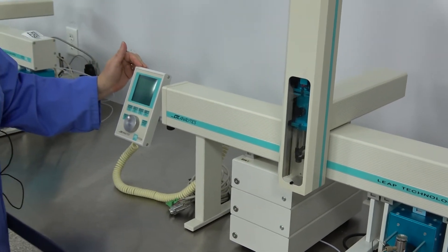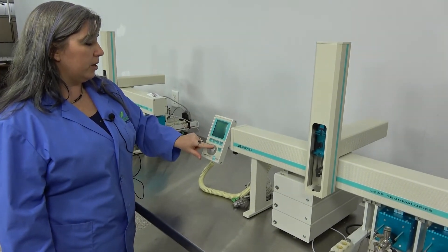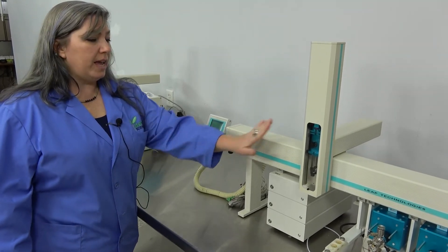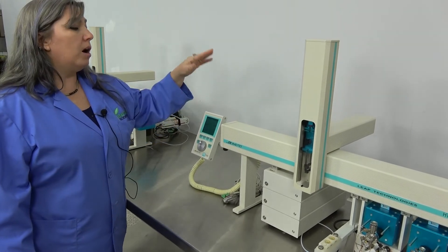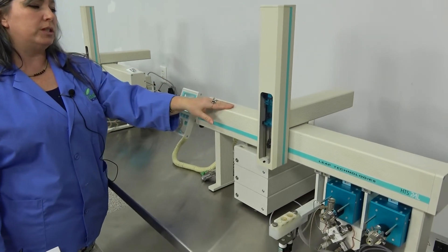That's just one example of how you can pre-program it. You can use this dial right here to program it for any location in your x, y, and z axes. It also has locations at the back for your consumable reagents.